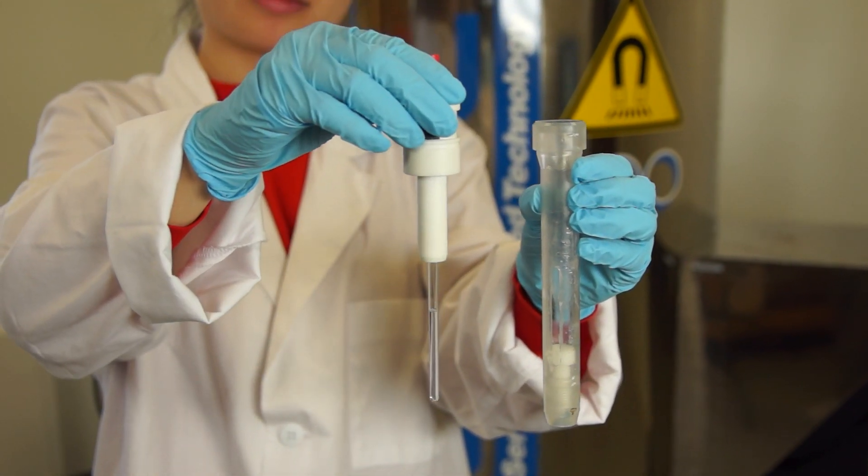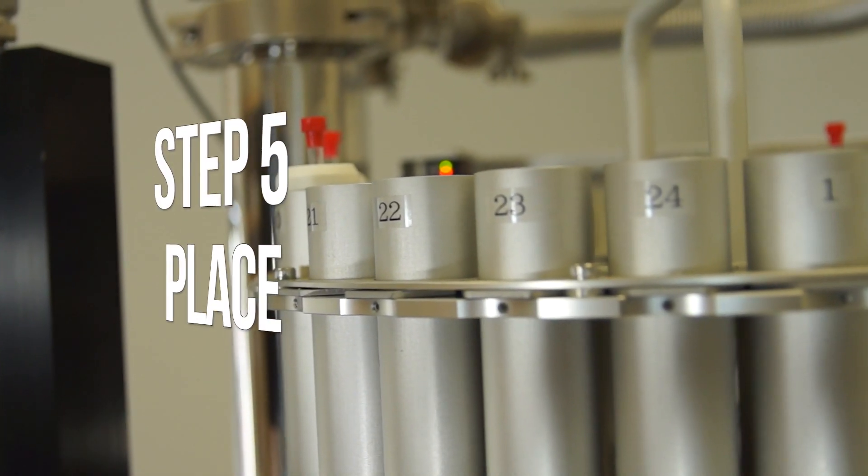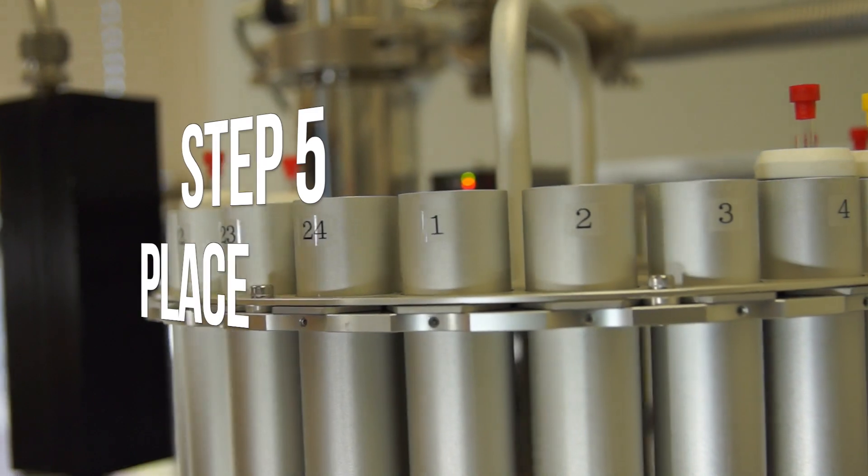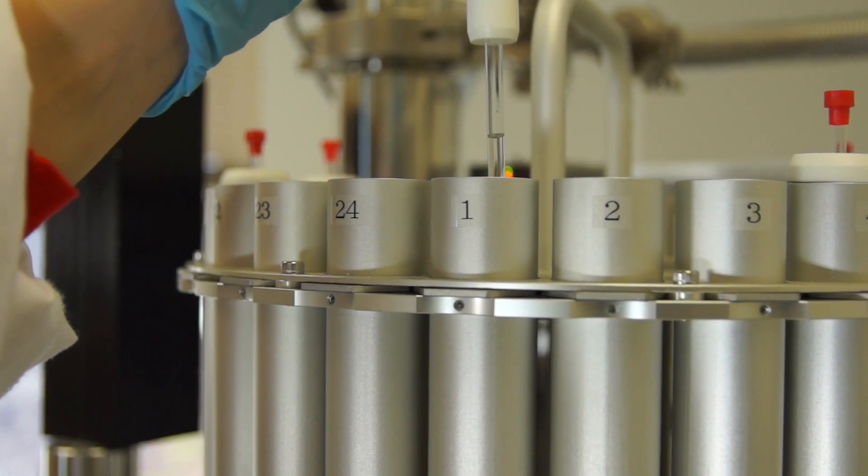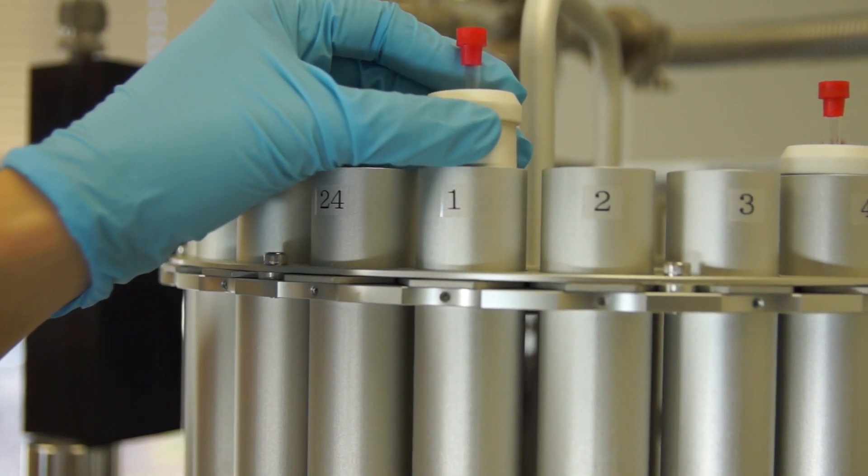When this is done, now you've prepared your NMR sample. Now, carefully place your NMR sample into the NMR carousel. Take note of your slot number as you want to make sure you analyze the correct sample.